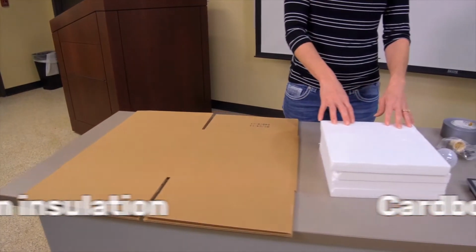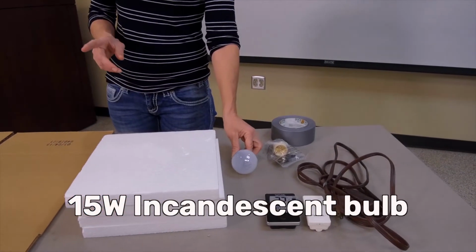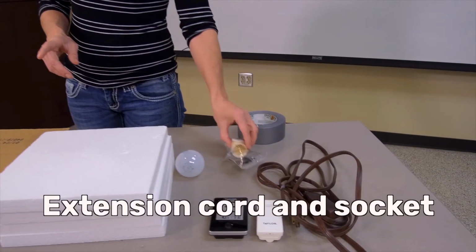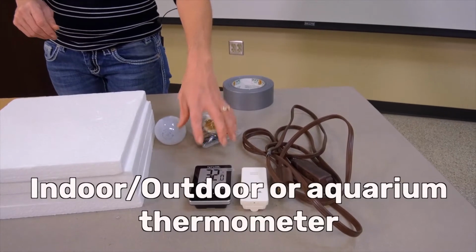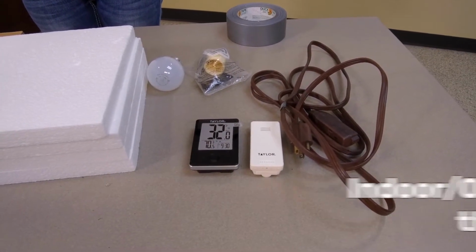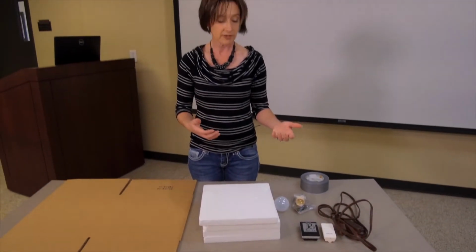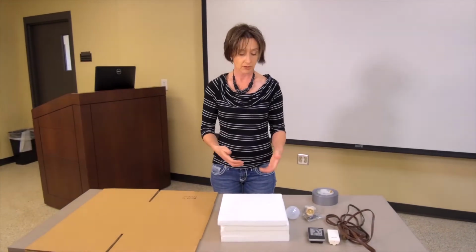Essentially, you need some sort of cardboard box, some styrofoam insulation, a 15-watt incandescent bulb, an extension cord and socket for the bulb, and then a way to monitor the temperature of the box, just to make sure we're in the right ballpark. So a simple indoor-outdoor thermometer, or they also make some other thermometers used in aquariums.